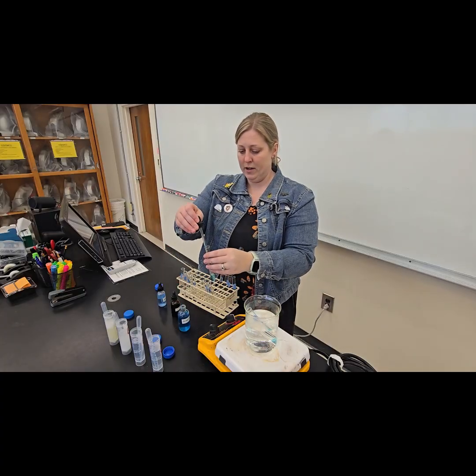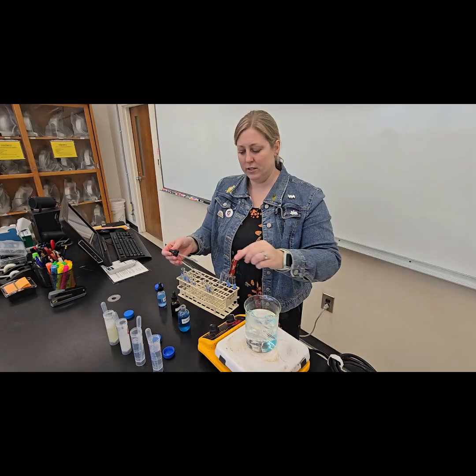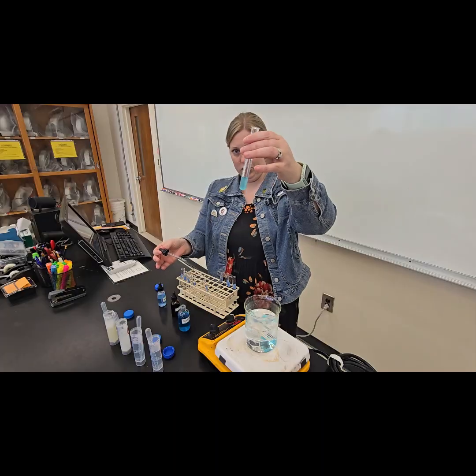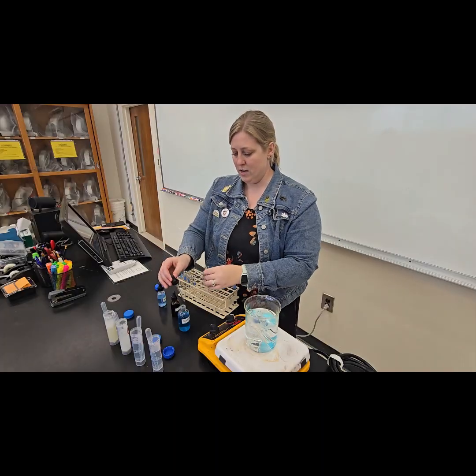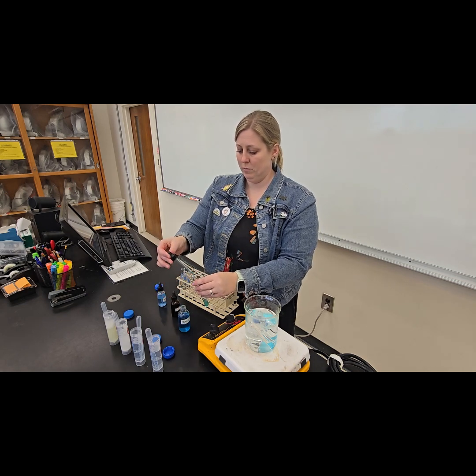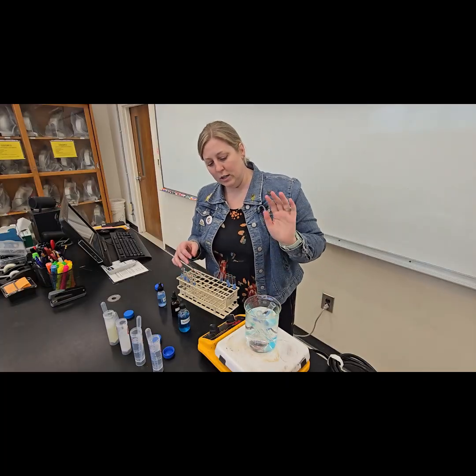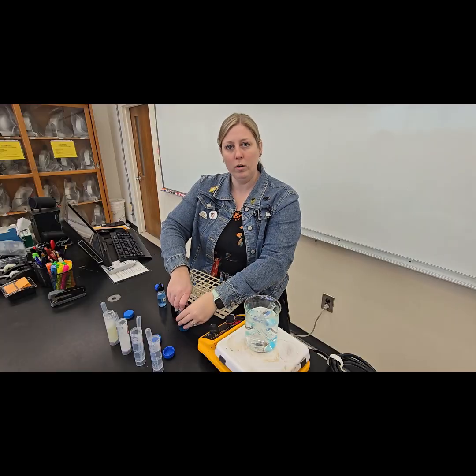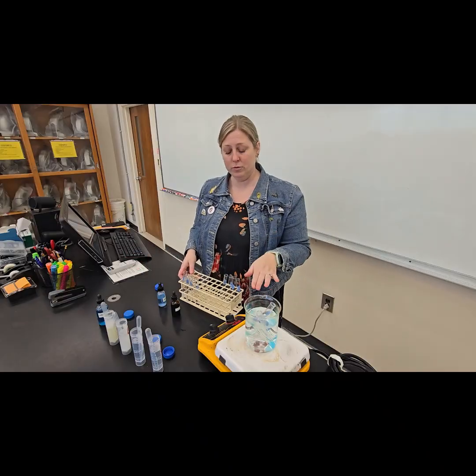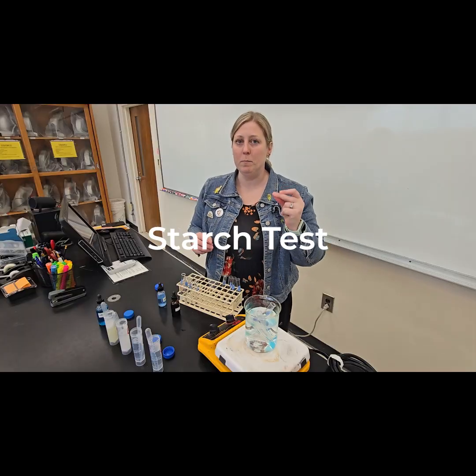And then I have my glucose, and again, no reaction until I warm it up, so that's not overly surprising. I'm going to add my starch, no reaction, and my albumin. We're going to add just a little bit more to the albumin. And again, no reaction. It should be a nice light blue color. And we're going to let those solutions sit in that warm water bath for about 5 minutes before we see the results. But while we're waiting for those results, we can do the starch test, the iodine test, and it should be an immediate reaction.